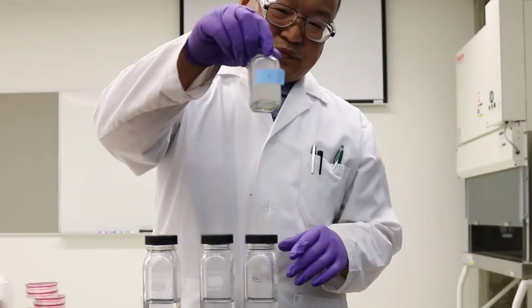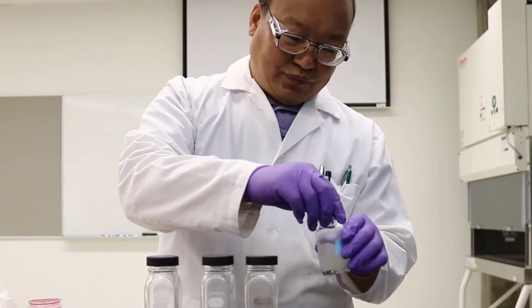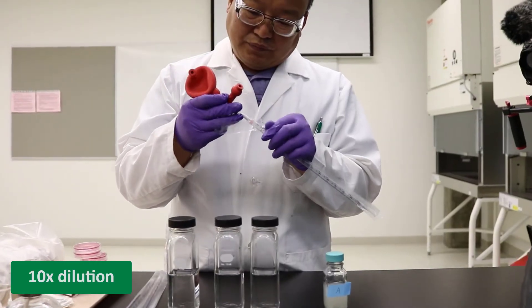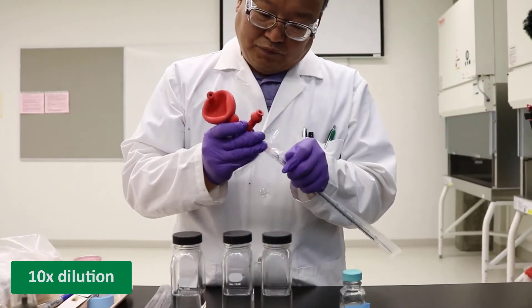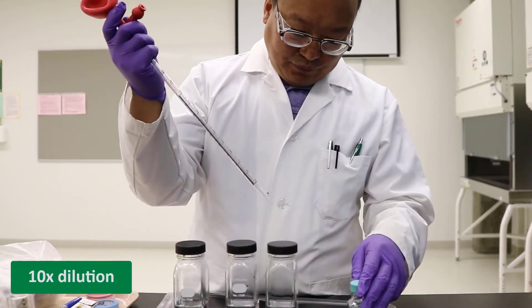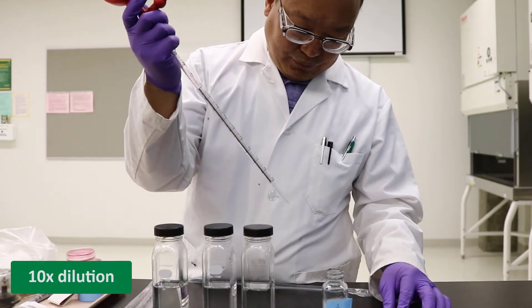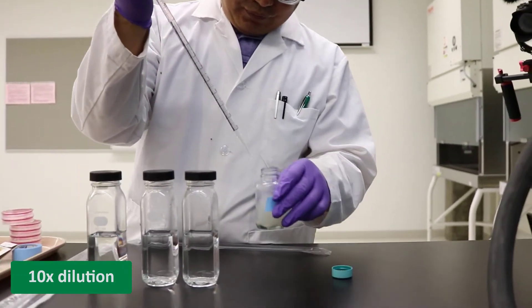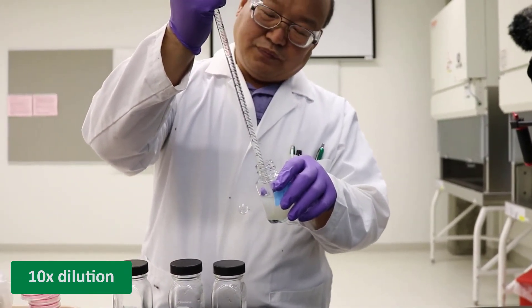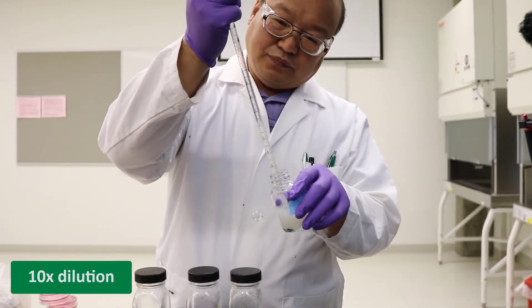Mix sample A well, then take 10 ml of sample and transfer it into a bottle with 90 ml of dilution solution, and mix it. This is the 10x dilution sample.